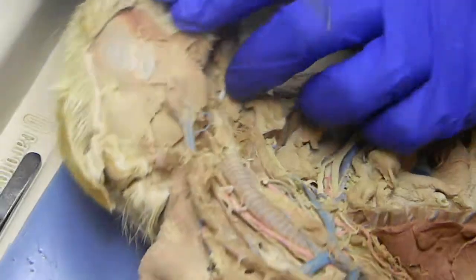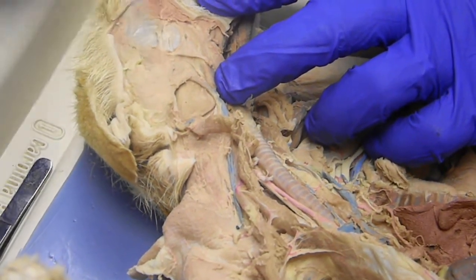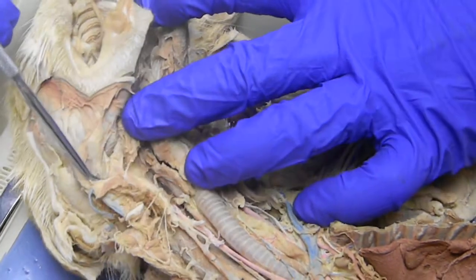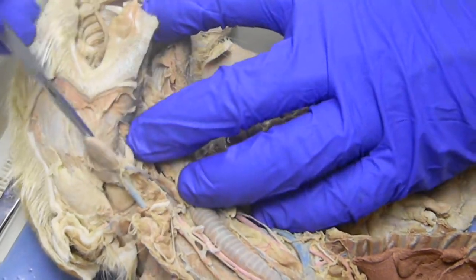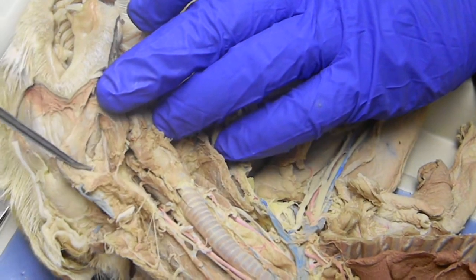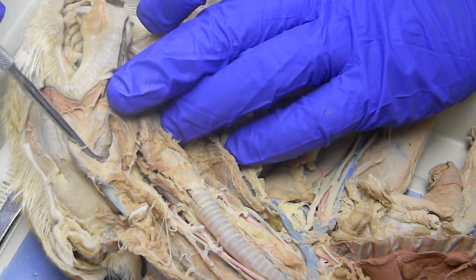On the outside of the oral cavity, we have the salivary glands: the parotid gland with the parotid duct, the submandibular gland. These are lymph nodes. We go underneath and we can find the submandibular duct, which is that white piece of ductwork that goes across there like that. The gland that's attached to it right there that looks triangular is the sublingual gland.